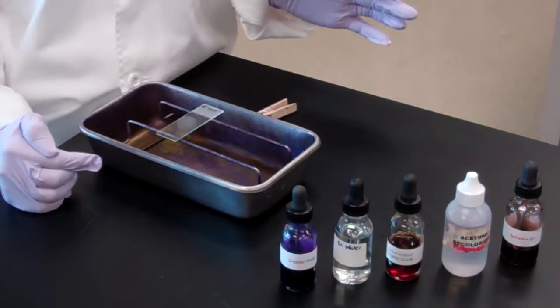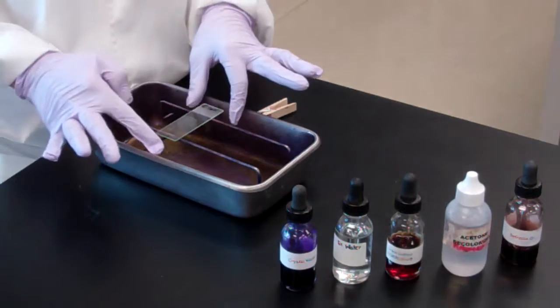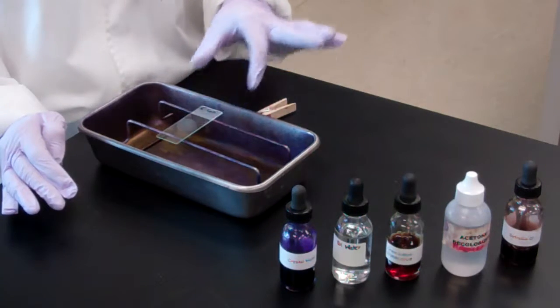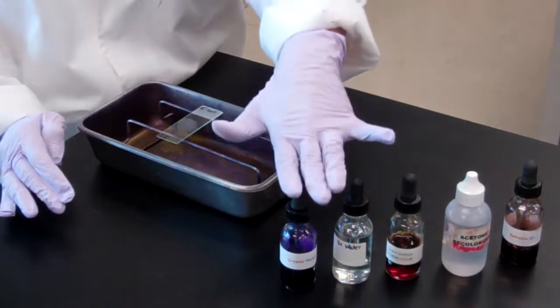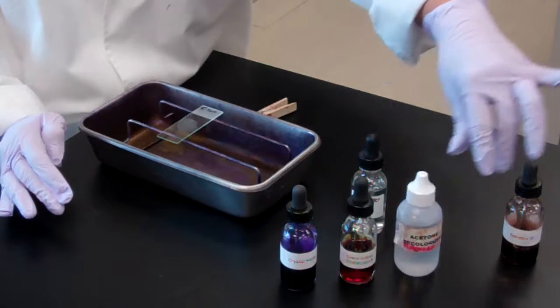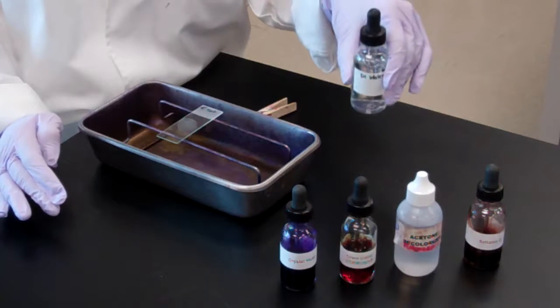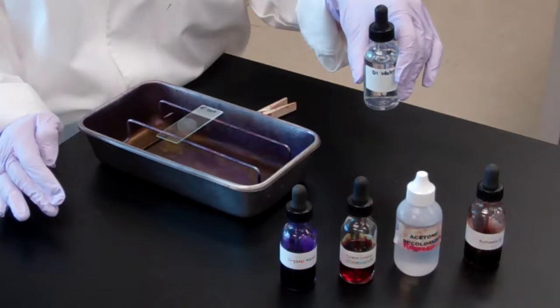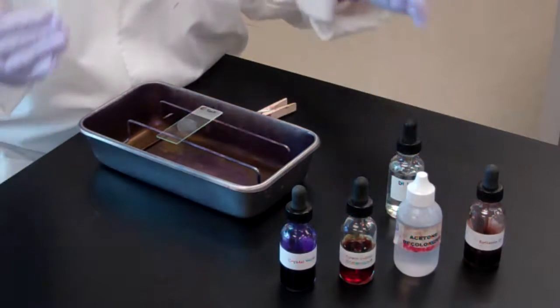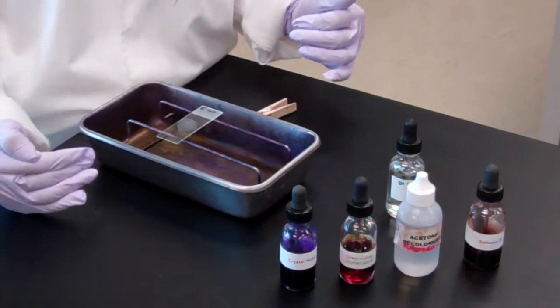For this procedure, you're going to be wearing your personal protective equipment. You are going to have your heat-fixed slide. We're working with E. coli. The reagents that are used for the Gram stain are crystal violet, iodine, acetone, which is a decolorizer, and safranin. We also need our dropper of water to rinse off the stains as we go through. Because this is a video demonstration, I'm not going to wait the timeline in between each stain as it sits, but you'll see the technique.